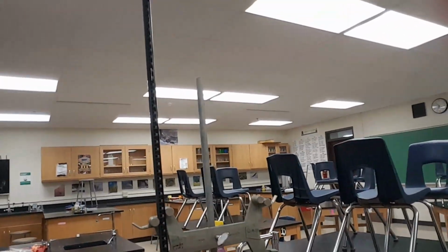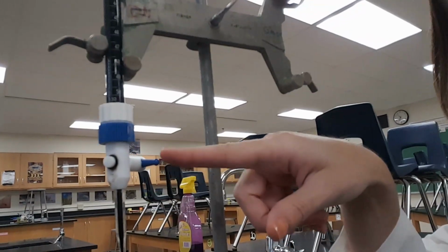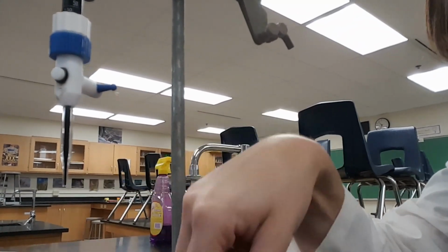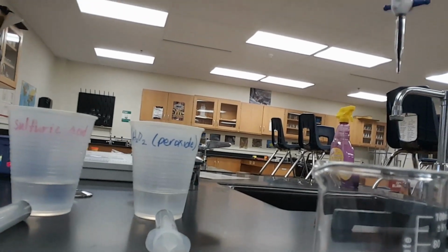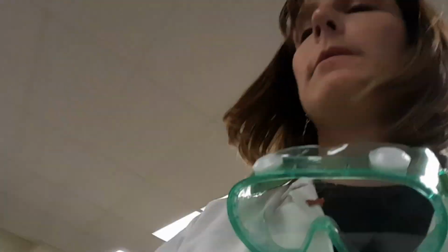Okay, so we got the materials set up over here. We have a burette. It's a graduated thing. It's got some potassium permanganate in it, so you notice the purple color. It has down here a stopcock on it that you will be turning carefully in order to titrate this through this pipette tip down into your solution. You also have some sulfuric acid, and you have hydrogen peroxide in little cups, and then there are also these syringes that are labeled so that you don't cross-contaminate.